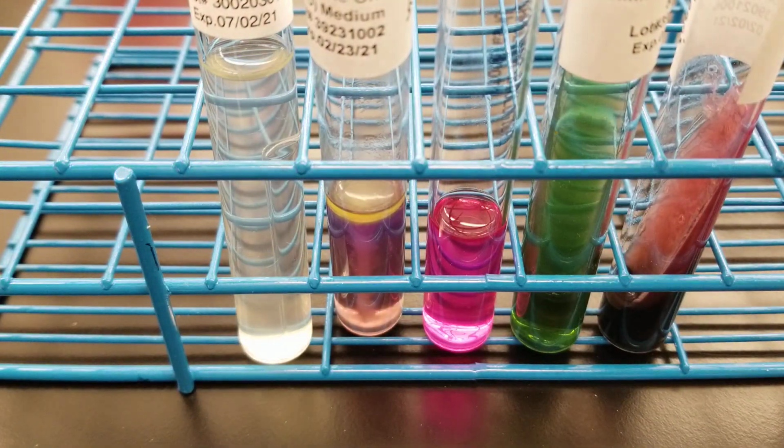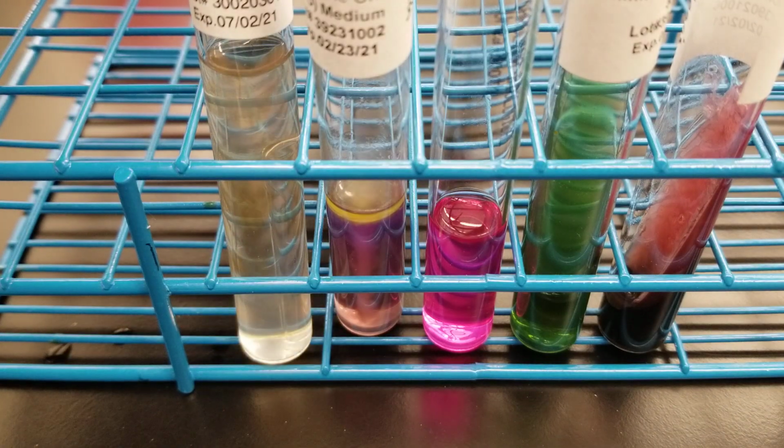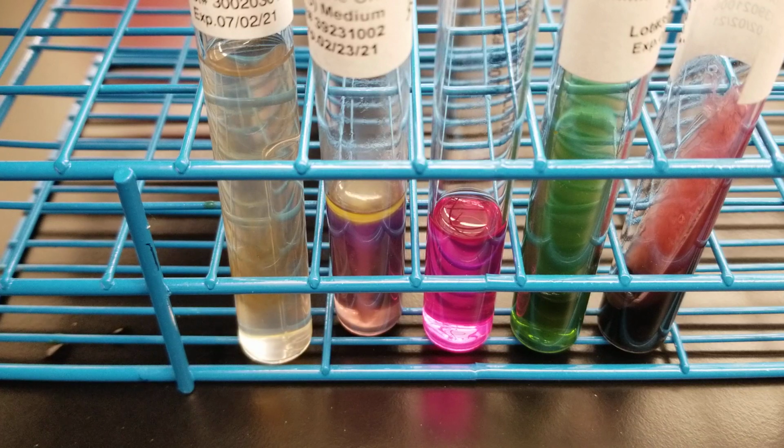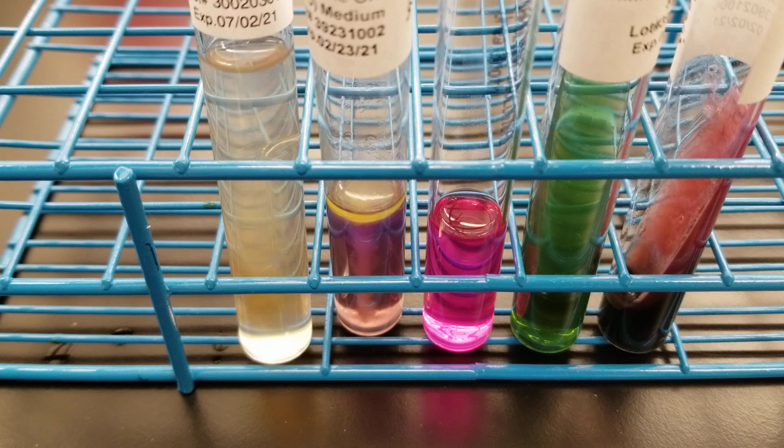Let's do the 5 drops here. Obviously, if you have something that doesn't make sense, you would want to retest it. I'm in the middle of a video, and it looks like I've seen that happen before from my notes.